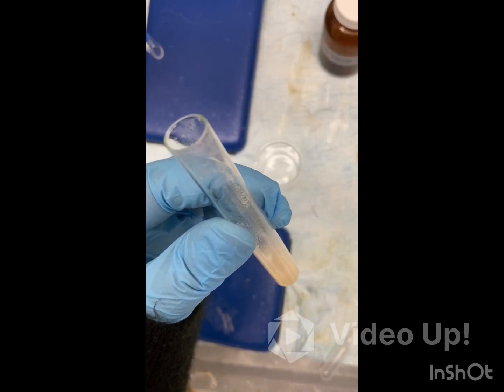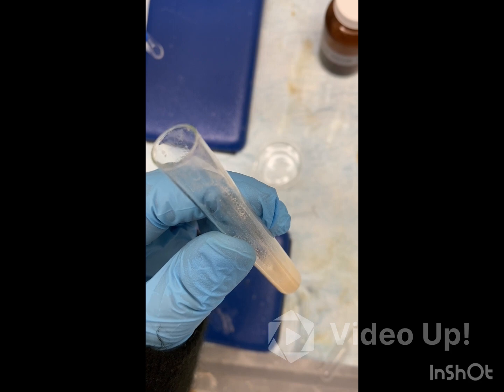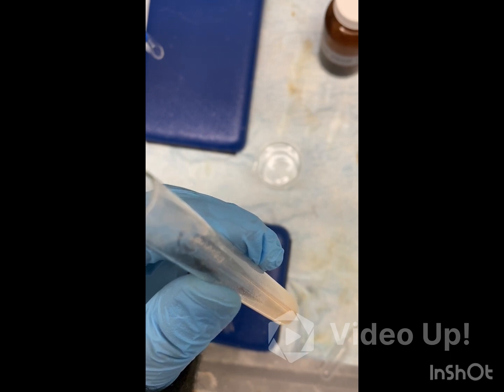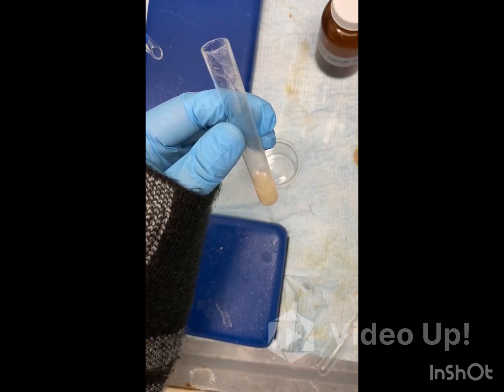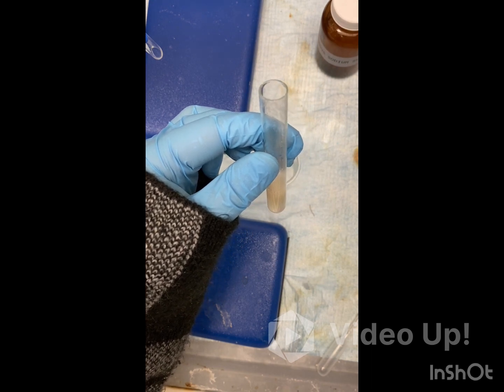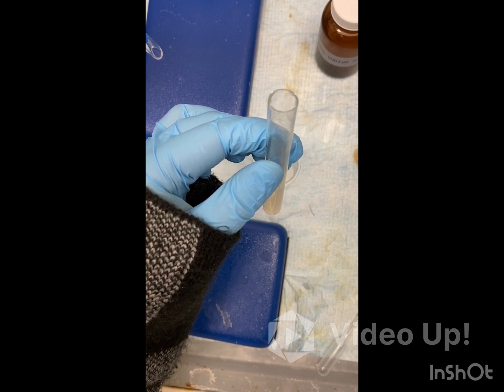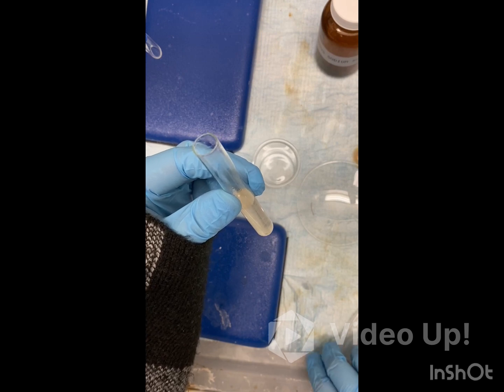Now we're going to work up the reaction. We're going to add 3 ml of water to the solution, then extract the organic layer with around 3 ml of diethyl ether. Remember that diethyl ether is extremely flammable, so do not put it near a source of heat. We're going to repeat this extraction, then wash the ether extractions with around 2 ml of water. We're removing the top layer and putting it into a 25 ml Erlenmeyer flask. Now we're adding the diethyl ether.